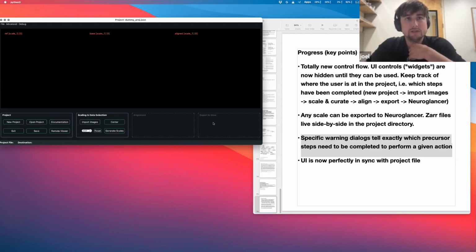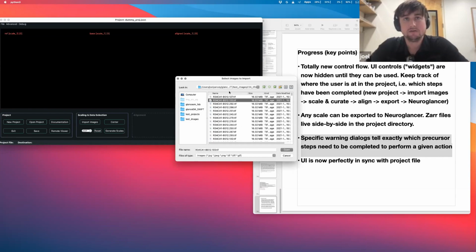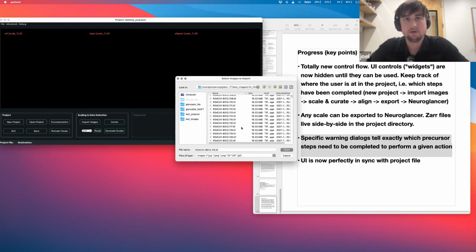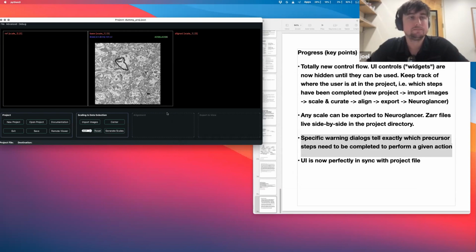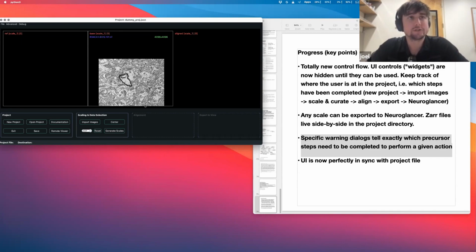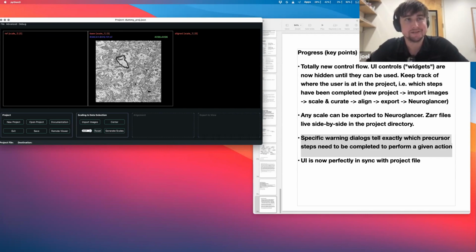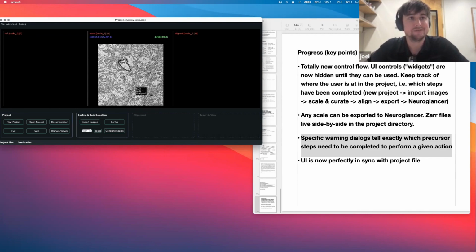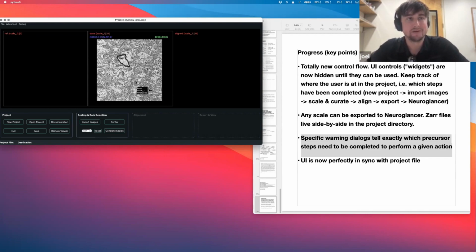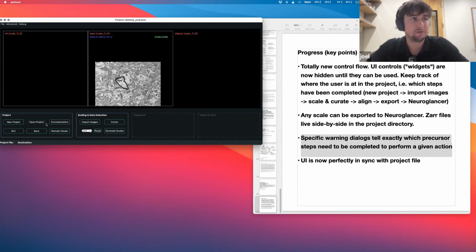No need to overwhelm the user with all of these other controls. So I'm going to import some images. We'll go to volume Joseph, the usual suspect. I'll just do 20 images. Oh yeah, full disclosure, with these new changes, I did mess something up. I've got this bug here. I know where in the code I'm getting this bug, but everything else should work except for this. See how it's following my mouse, so ignore that.